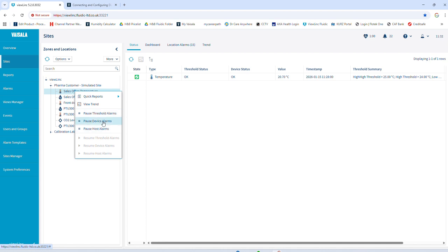Device alarms would be if the device, the RFL100, which is what the probes are connected to, the sensor, if that disconnected, then that would be a device alarm. And a host alarm would be the higher end again. If there was a problem with what they call the host, would be if the PC shut down or if the access point all the sensors are talking to failed. So these are different ones. You can pause all of them. If you're defrosting a freezer, pause a threshold alarm.